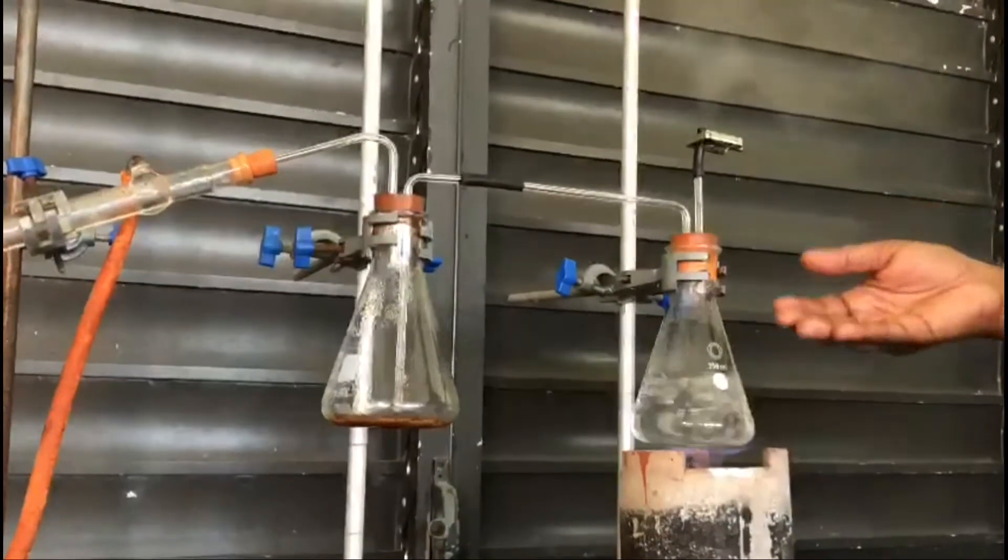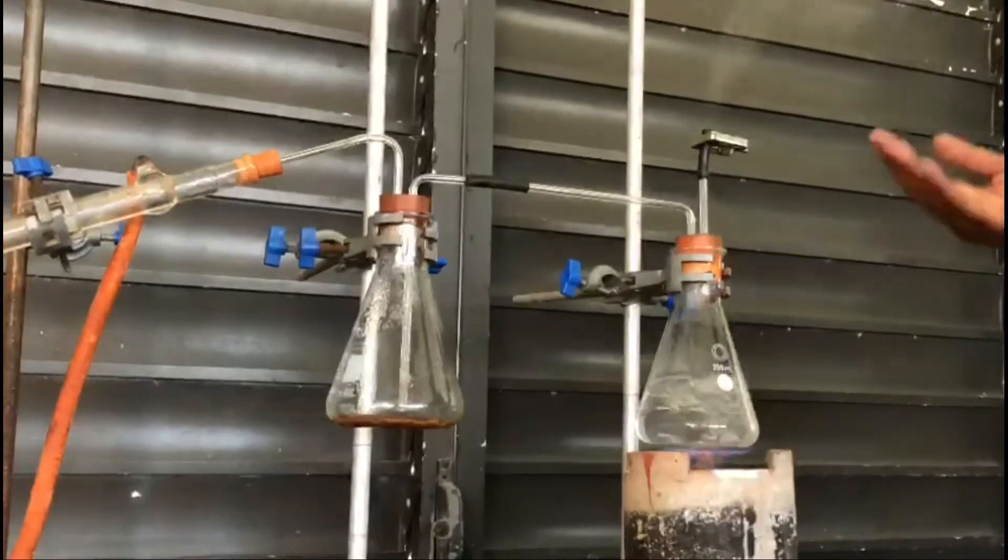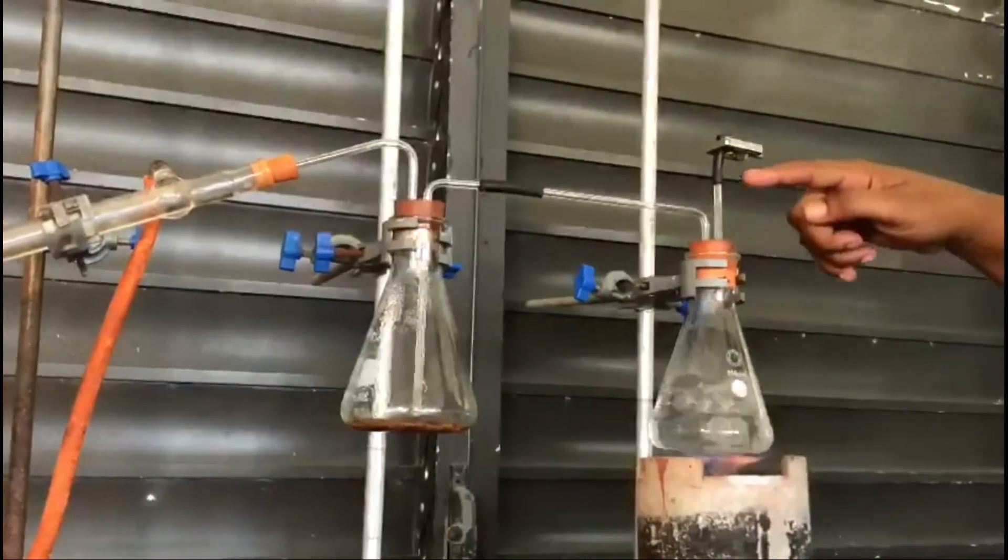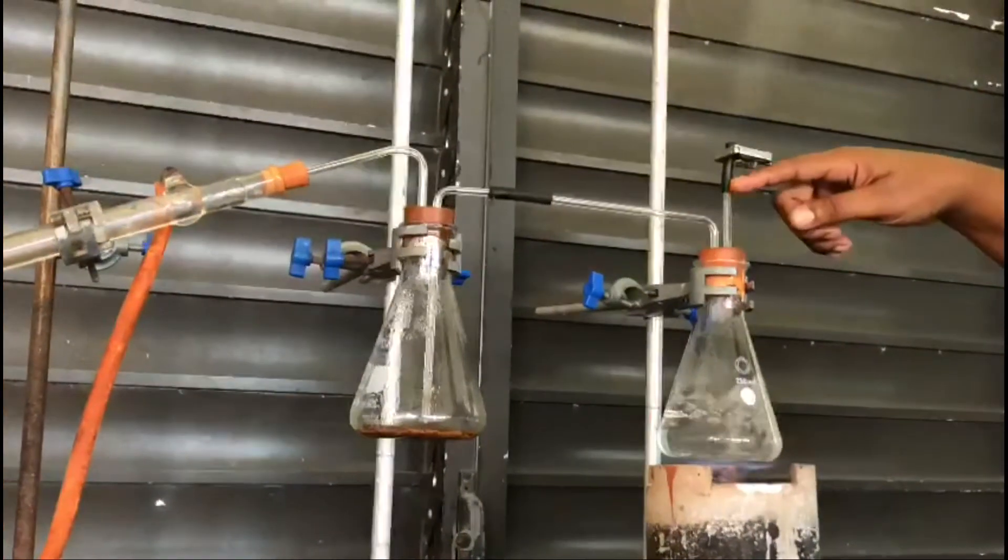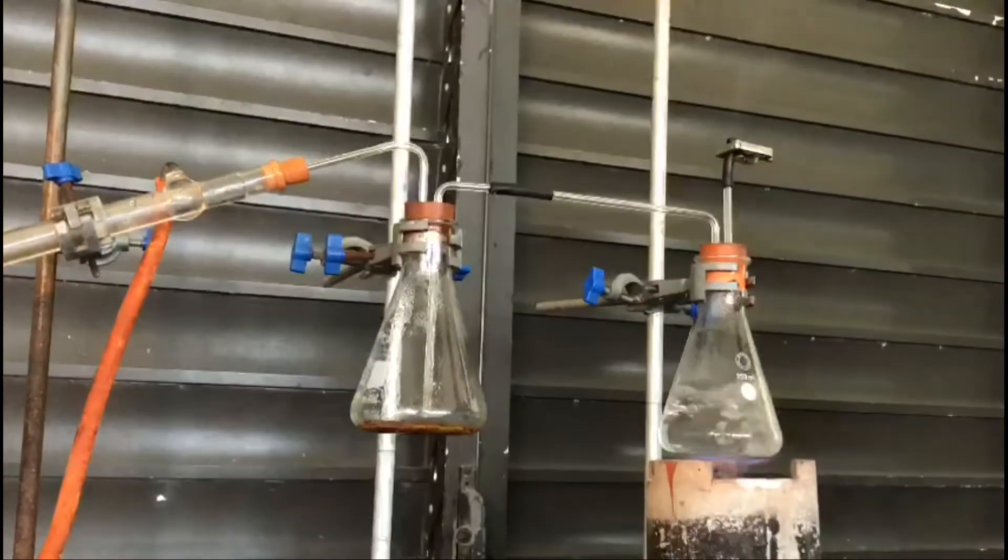This would be dangerous if the pressure builds up, as the glass could explode and break. So we're venting some of this through this piece of tubing which serves as a vent.